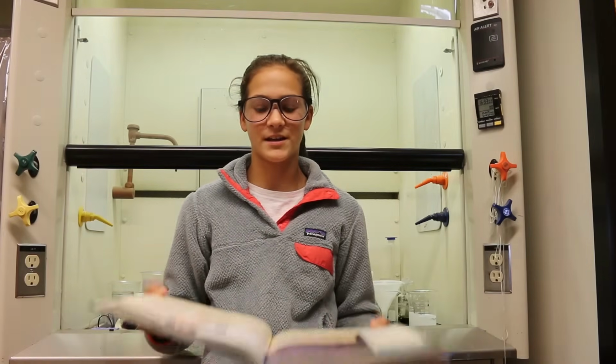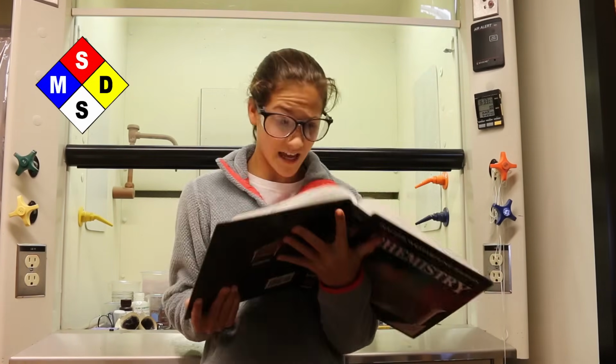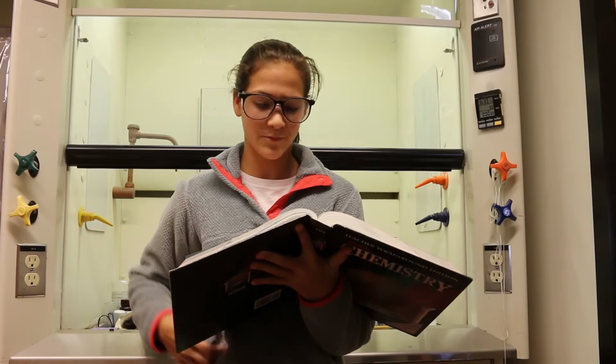But I got smarter, I got information really quick. The MSDS tells health hazards that might make me sick. Like potassium is flammable, really gives a kick. I took it once, then I check it twice.